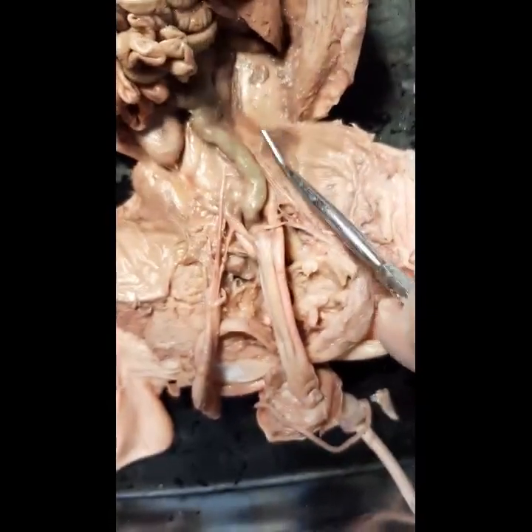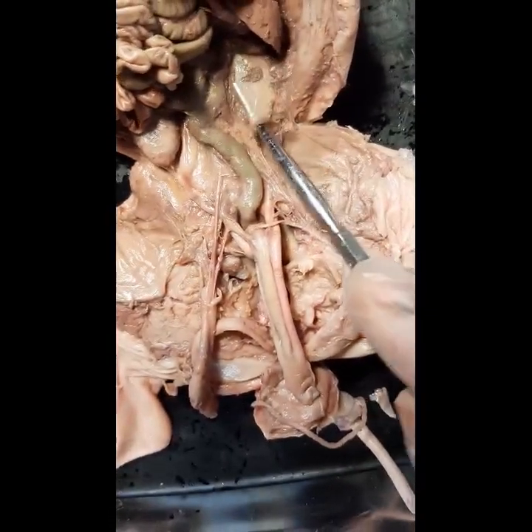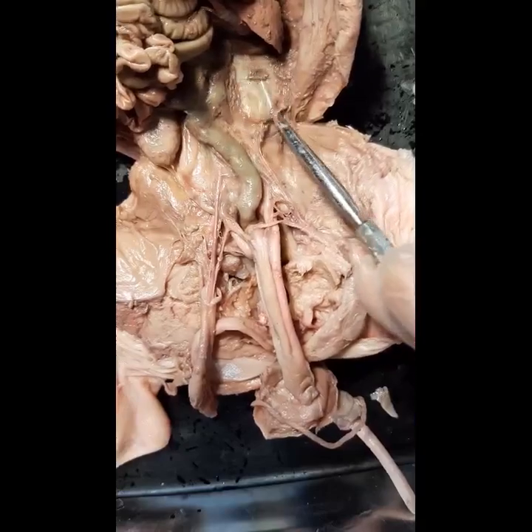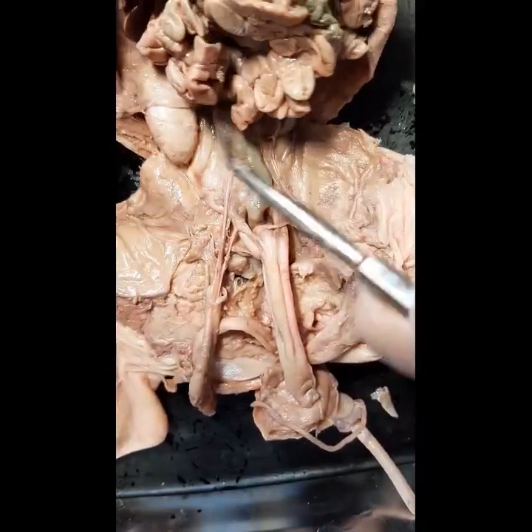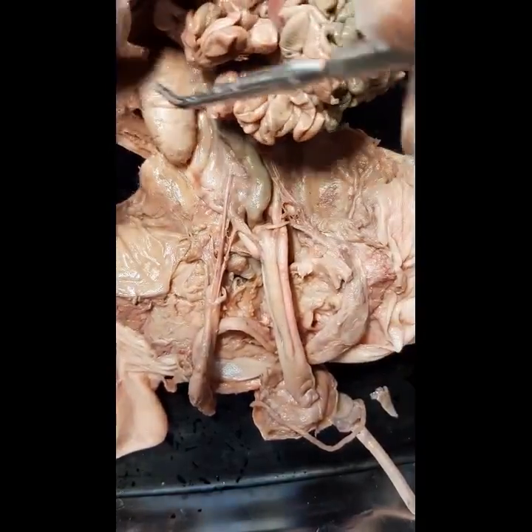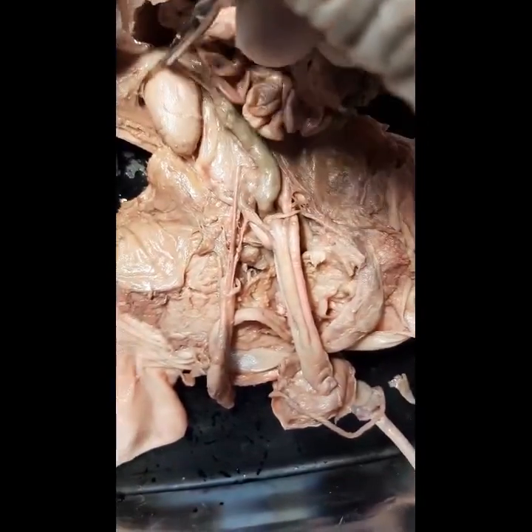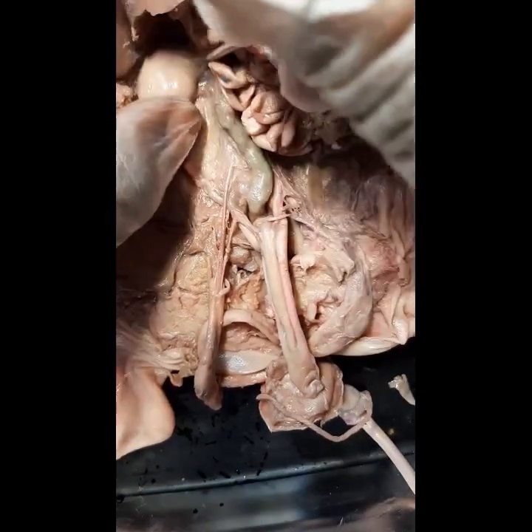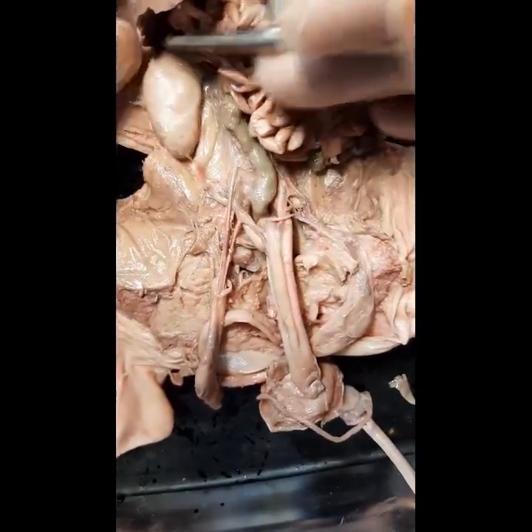Same thing on the left side — you have a layer of parietal peritoneum and the kidneys are behind it. If we clear the parietal peritoneum, then we get to see the kidney.